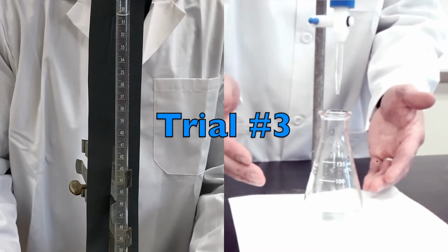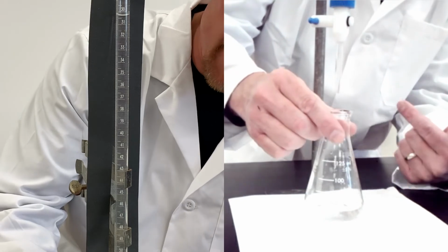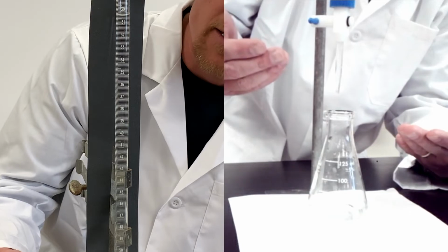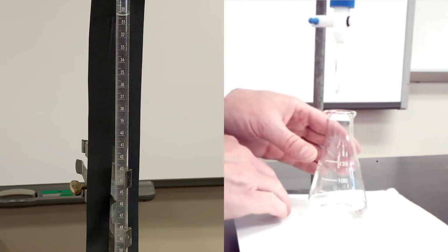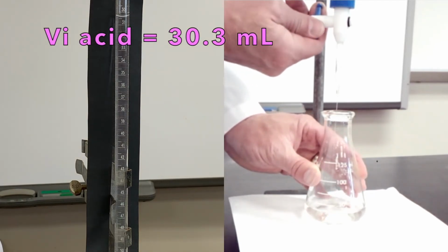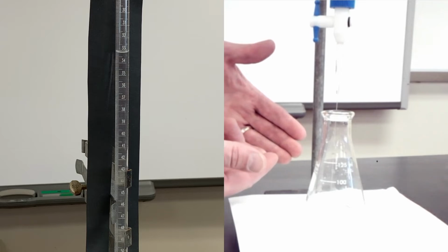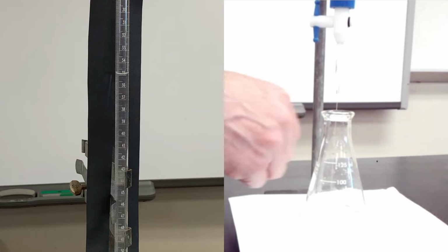All right, we're here for our third trial, and we are going to add our last bit of acid into our flask. I've already added the phenolphthalein, I've already added the distilled water, and so now we've just got to put our acid into the flask. Right after, we'll do the base and titrate it, see what we get for a concentration after our 3 trials. So you'll notice I'm at 30.3. All right, again, I'm gonna shoot some acid in here. Shouldn't see any color change, of course, because remember, phenolphthalein does not change color in the presence of an acid or in the presence of water. It's just gonna stay clear.